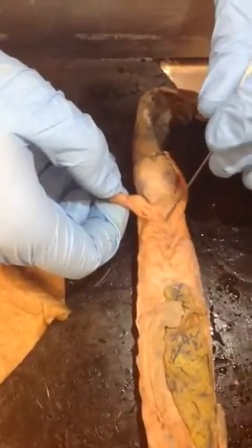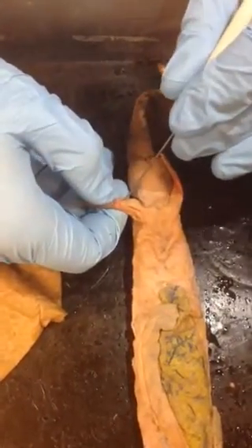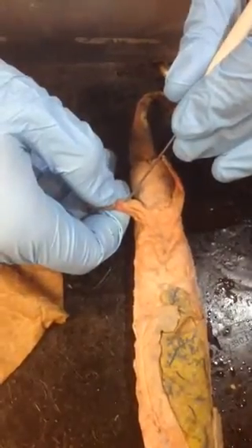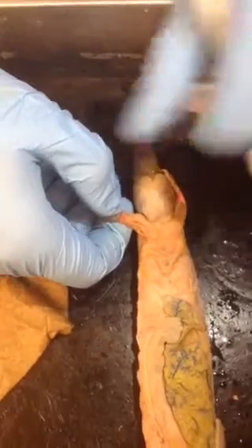And then this one is easy. This is pubo-ischiofemoralis externus. There's one more here, this tiny little one right here. That one is called ischioflexorius. You will not need to know anything about the cloaca.